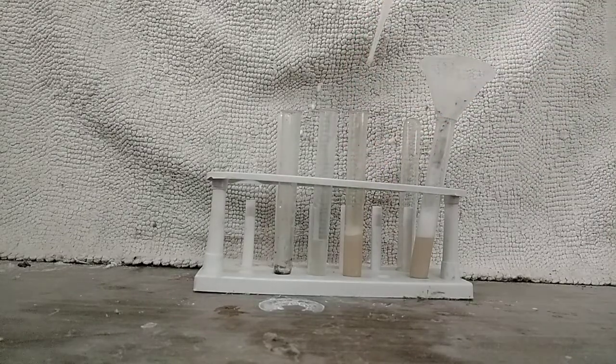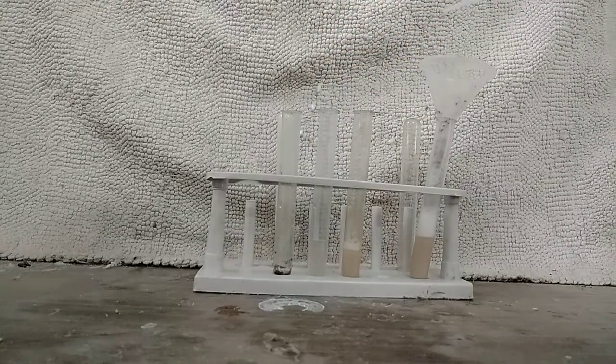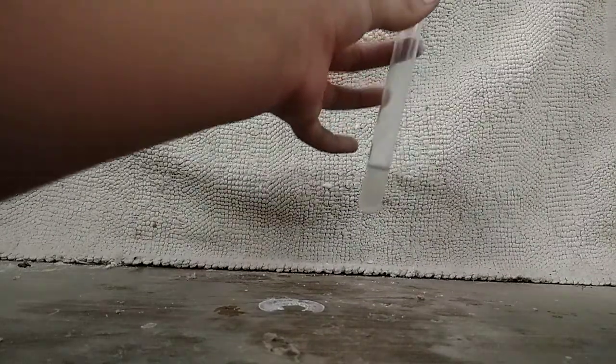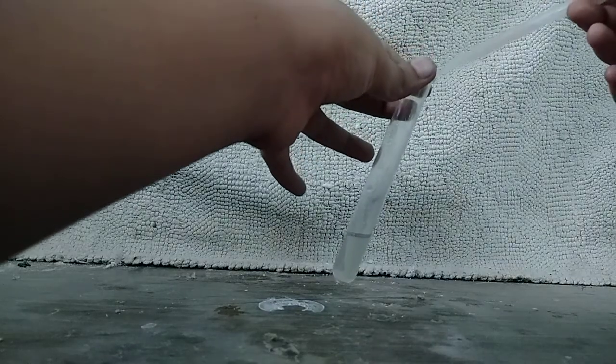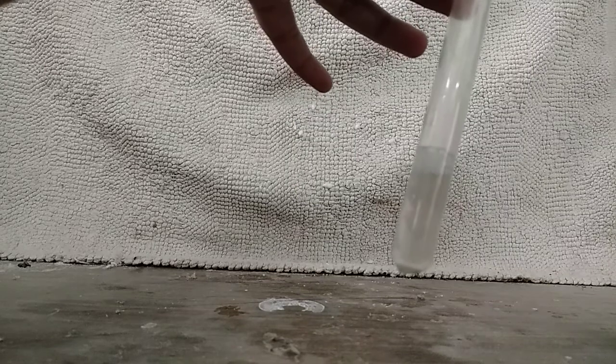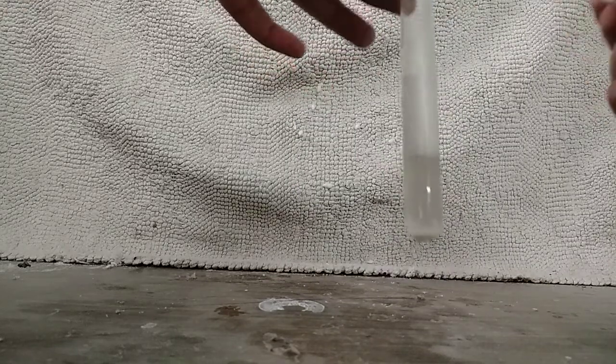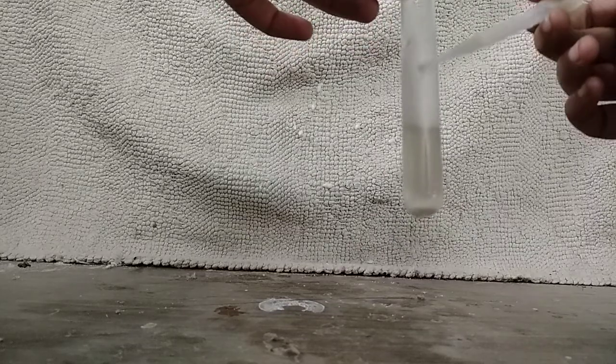Now I will take some of this solution into my pipette and add it to the calcium chloride solution. As soon as I add it, you can see the formation of a white precipitate, which is also insoluble in water.